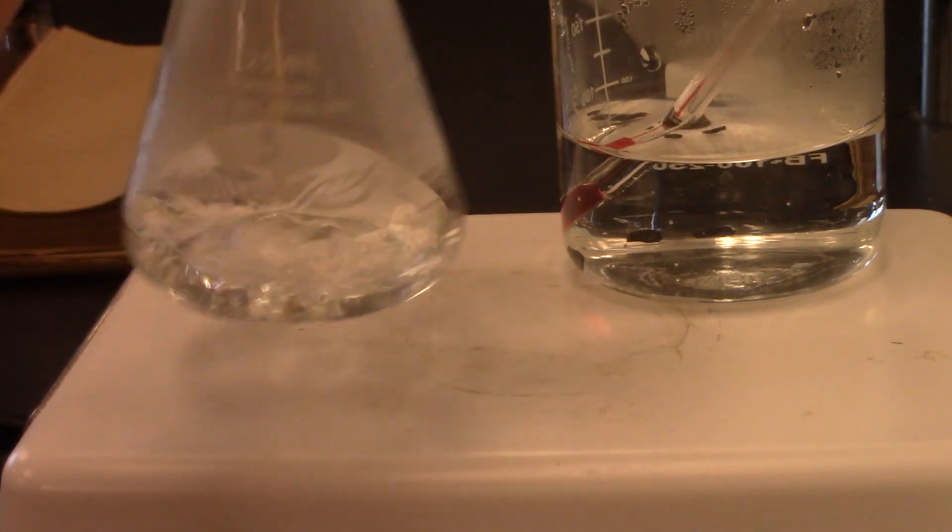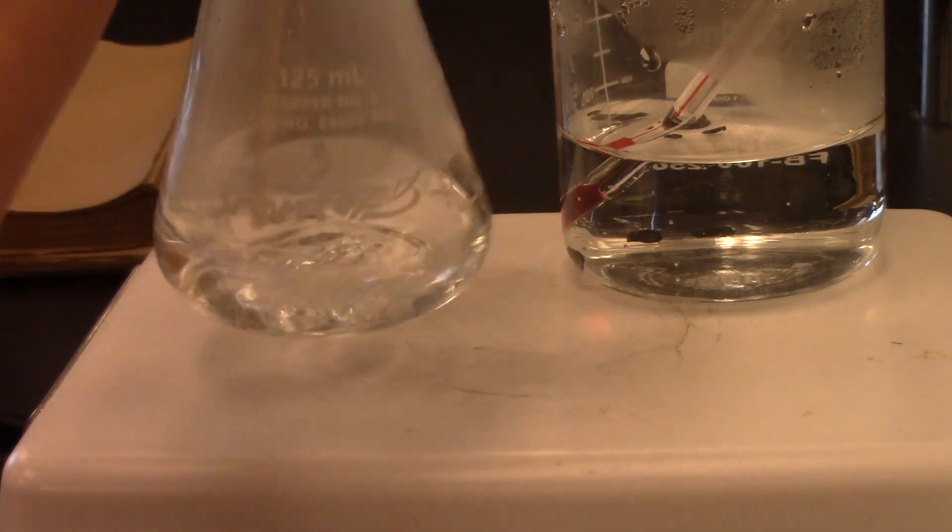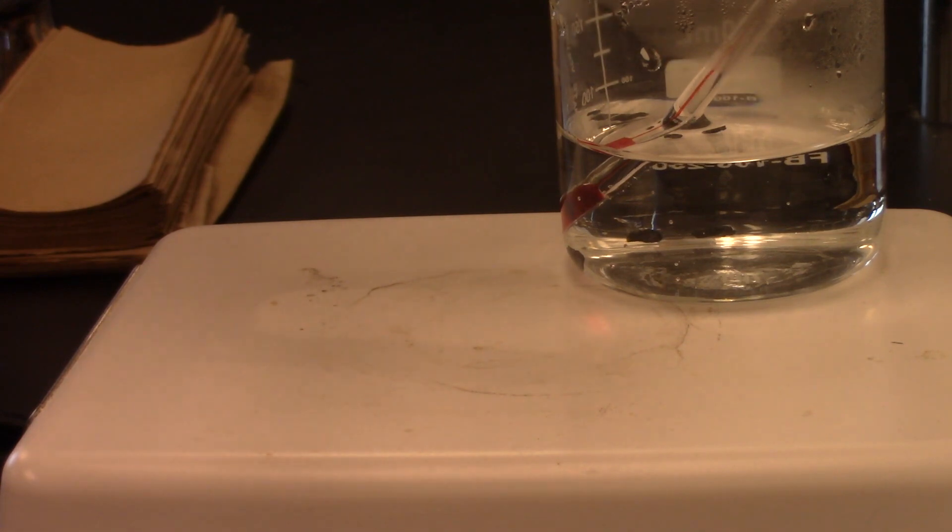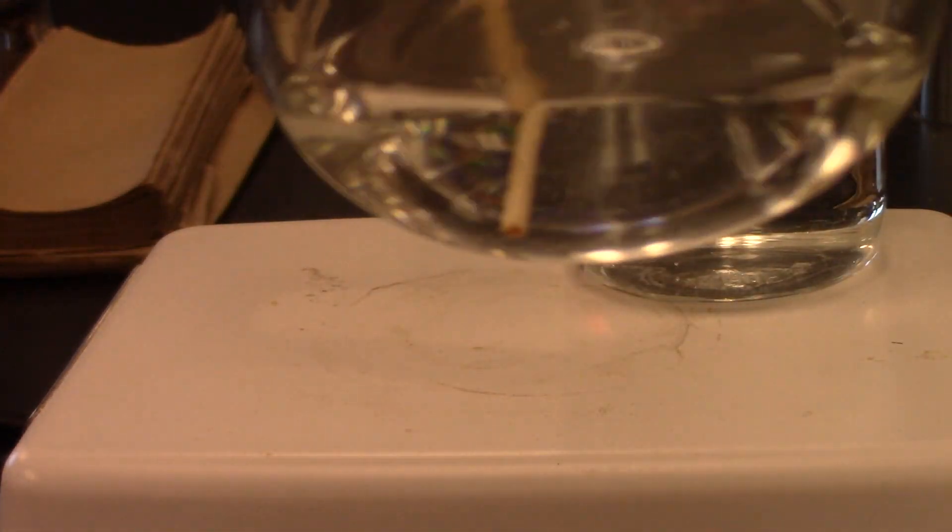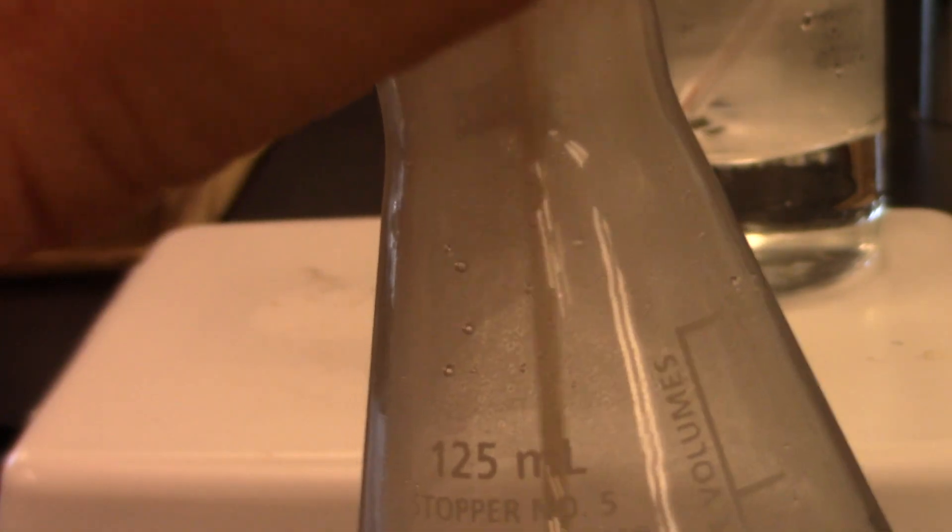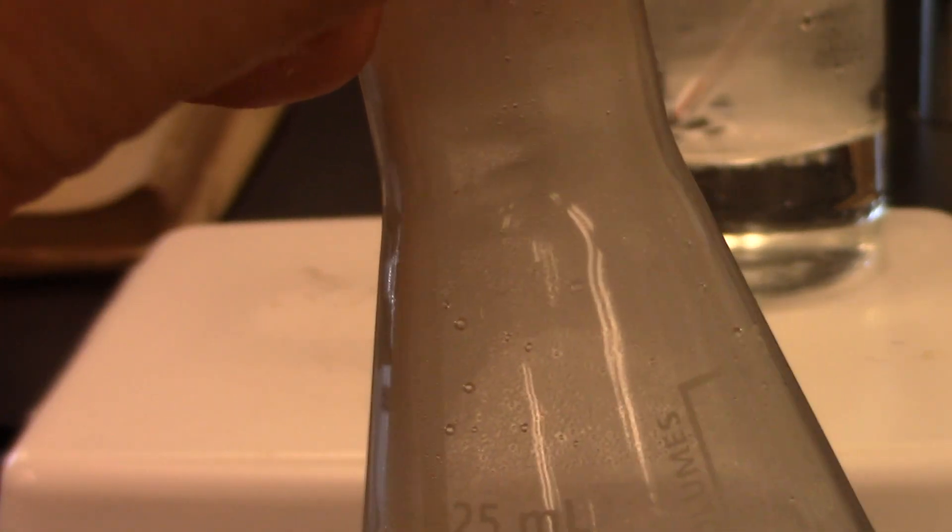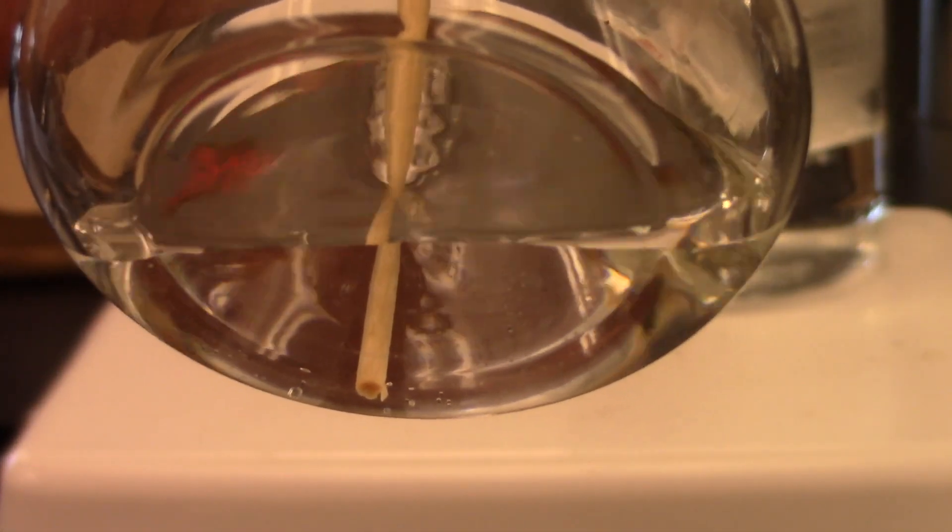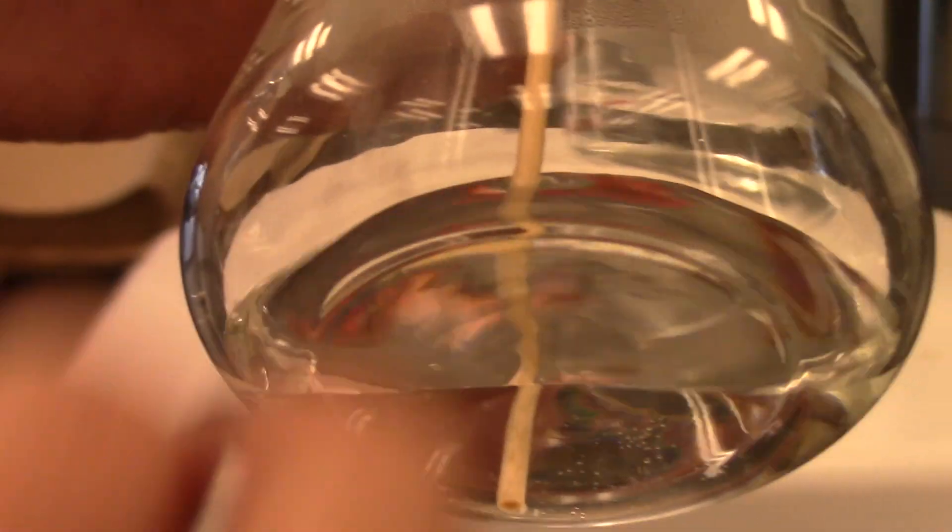Unfortunately, you do sometimes get to the point when you're down in the last little bit of solid where it's difficult to tell if it's solid or if it's bubbles. And it looks like I am now fully dissolved. It has completely dissolved. The only thing that's left down there are actually little air bubbles that I can free up right now. And so that is a nice solid-free flask. This little stuff that you see down here, those are just air bubbles.